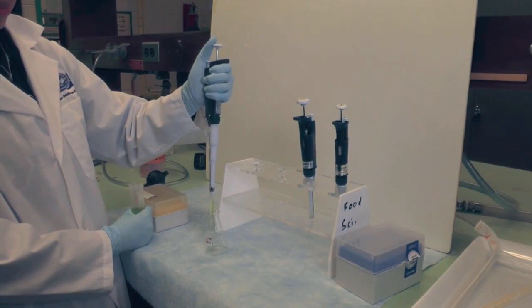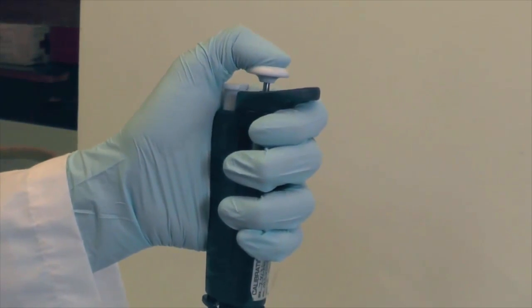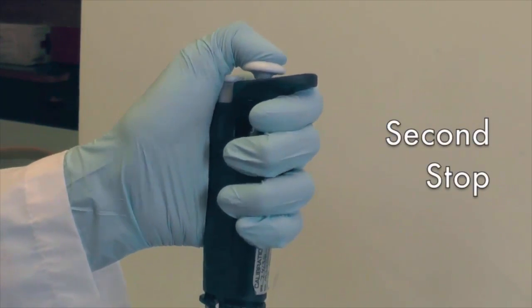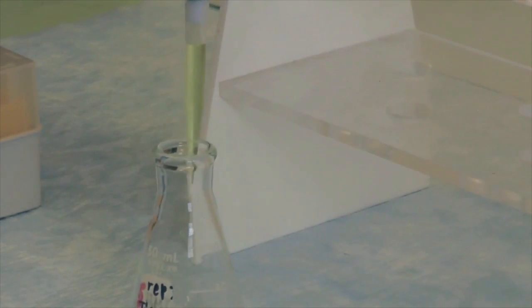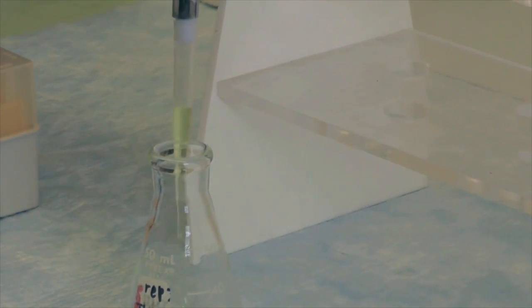To dispense the liquid, press on the push button to release most of the liquid. Then further apply pressure on the push button to a second stop to eject the last drop for accurate volume transfer.